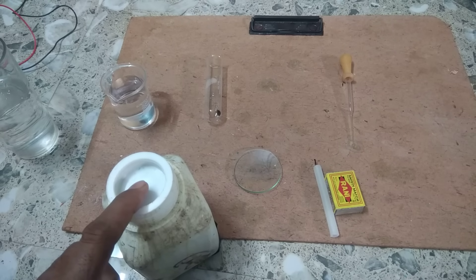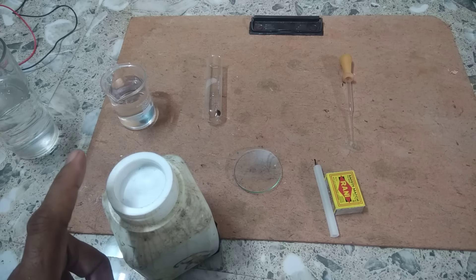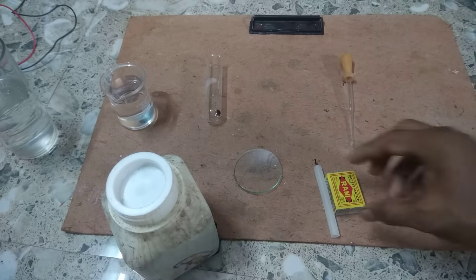Now let us take this copper sulphate in a test tube and let us heat it and see what happens.